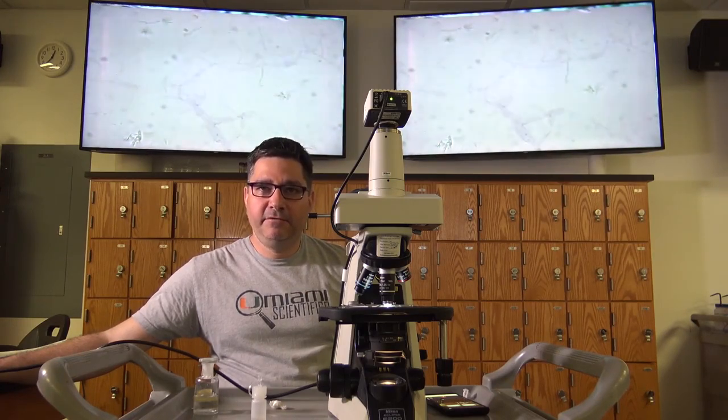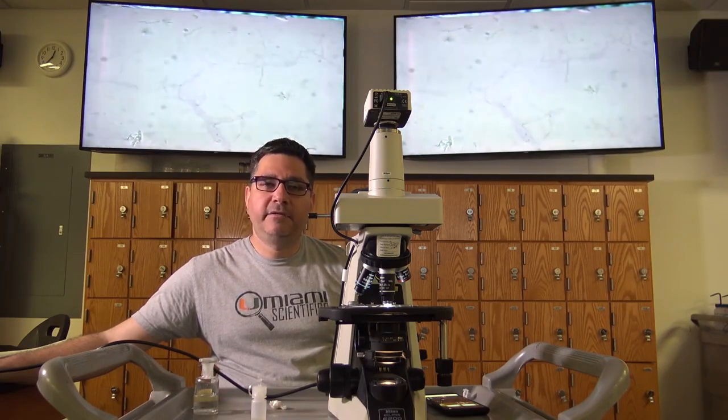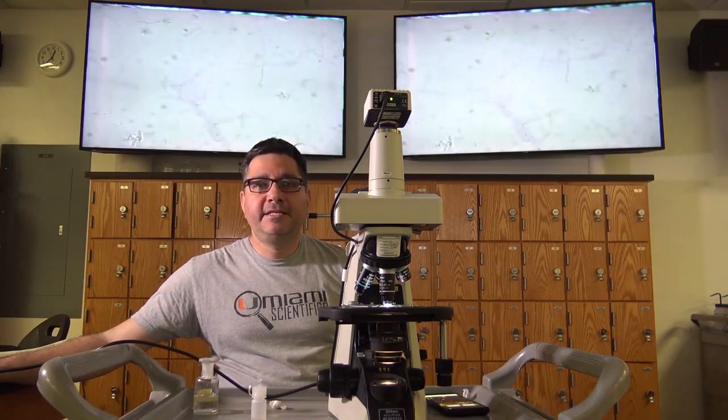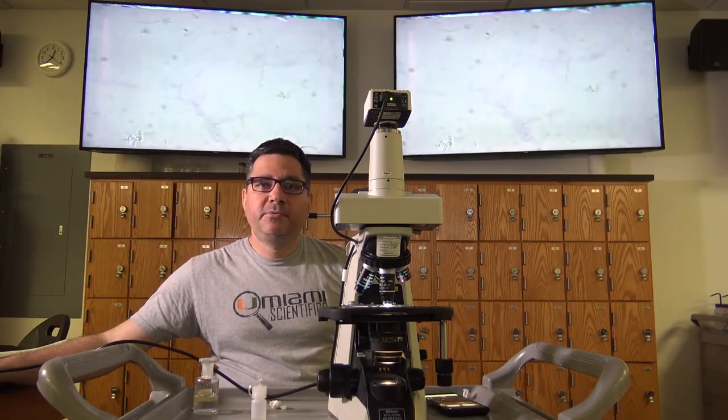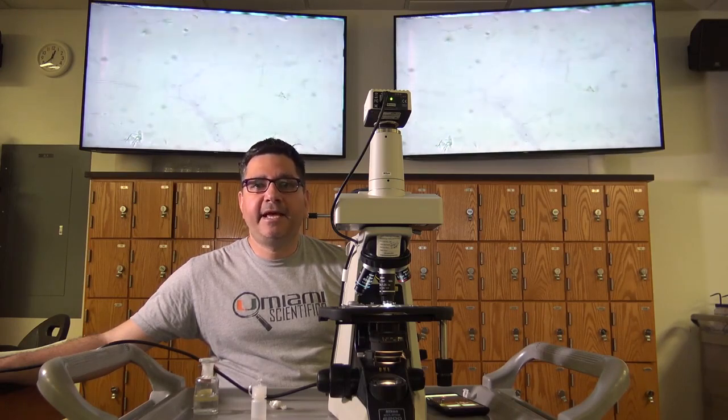into focus. If you lose the specimen at 100x with the oil, do not go back to the 40x. Instead, go directly to 4x, fine focus, then to 10x, fine focus, and instead of going to the 40x, you would rotate the objectives in the opposite direction and refocus using the 100x objective. By doing it this way, you do not place any of the objectives in contact with the oil except for the oil immersion objective. If this does not solve your problem, check to make sure that your slide is not upside down.